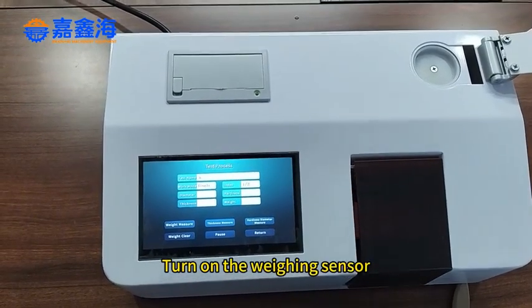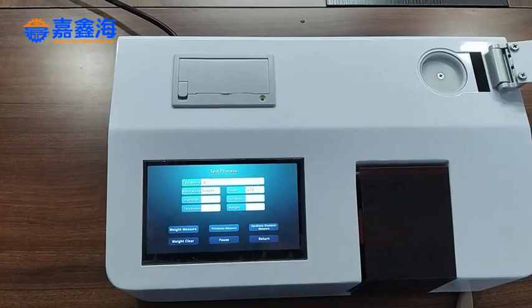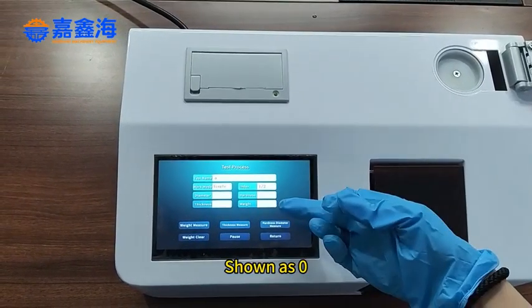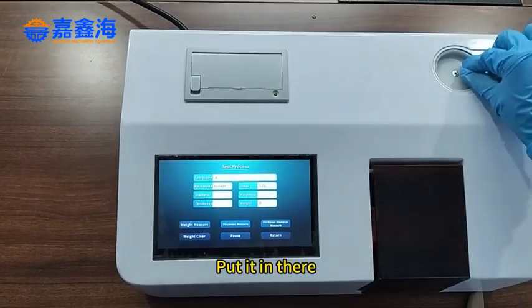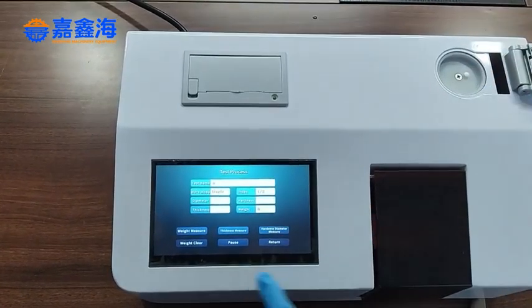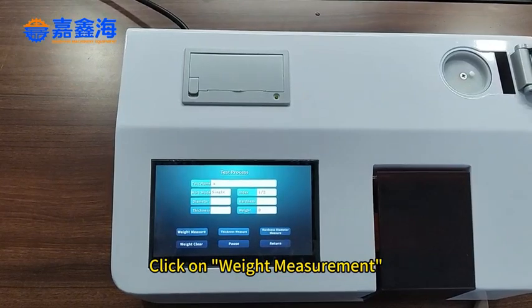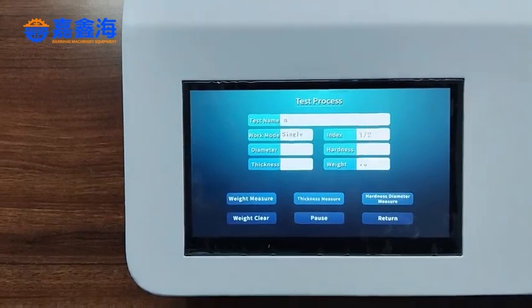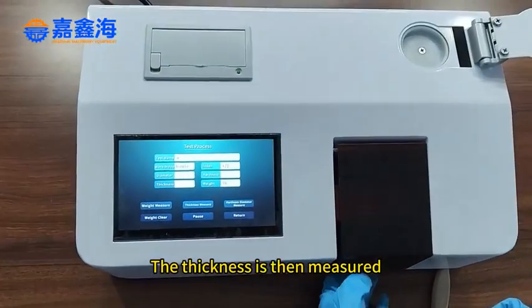Turn on the weighing sensor. Reset the weight to 0. Shown as 0. Put it in there. Click on Weight Measurement. The thickness is then measured.